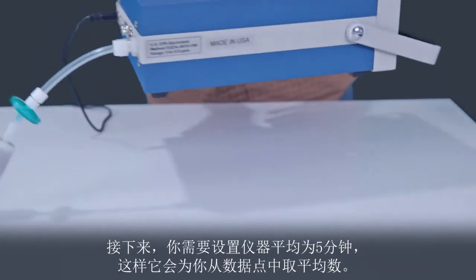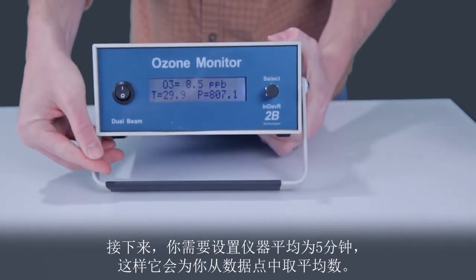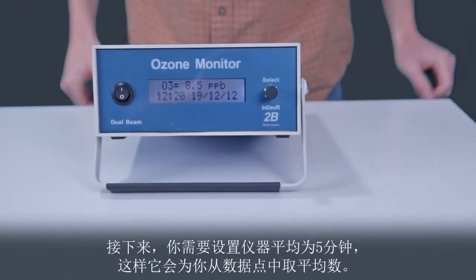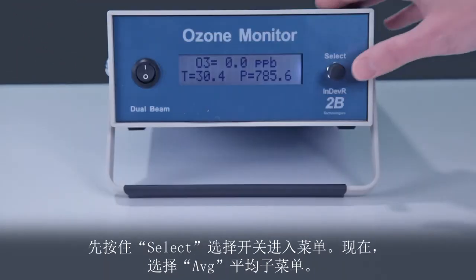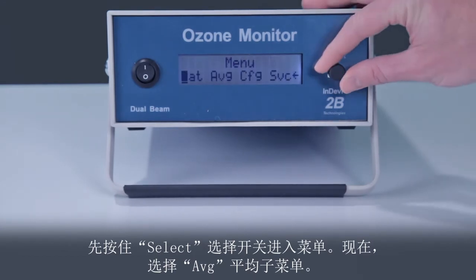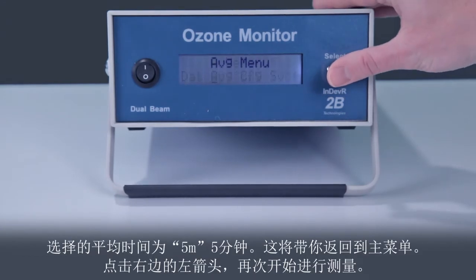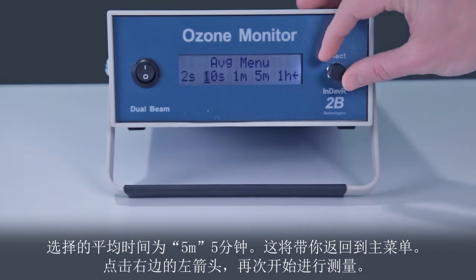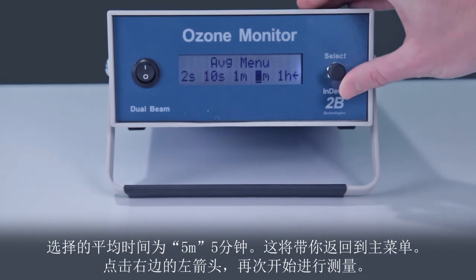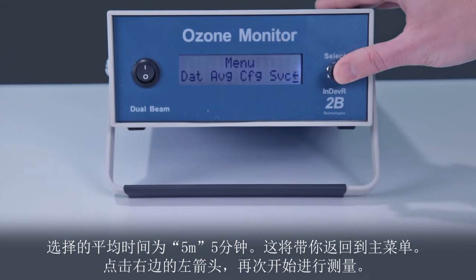Next, you will need to set the instrument averaging to 5 minutes, so it will average data points for you. First, hold the select switch to reach the menu. Now select the averaging submenu. Select 5 minutes for the averaging time. This returns you to the main menu. Click the left arrow to begin making measurements again.